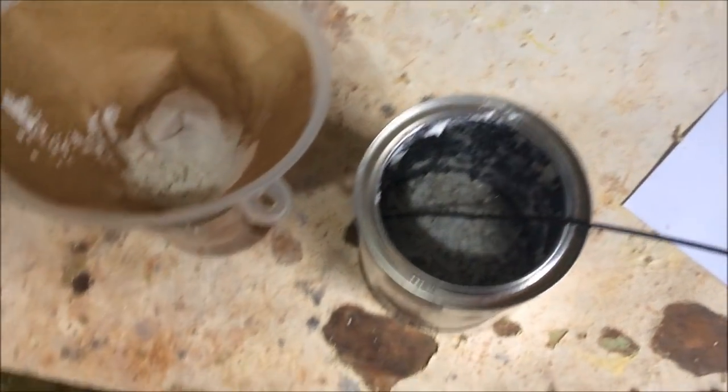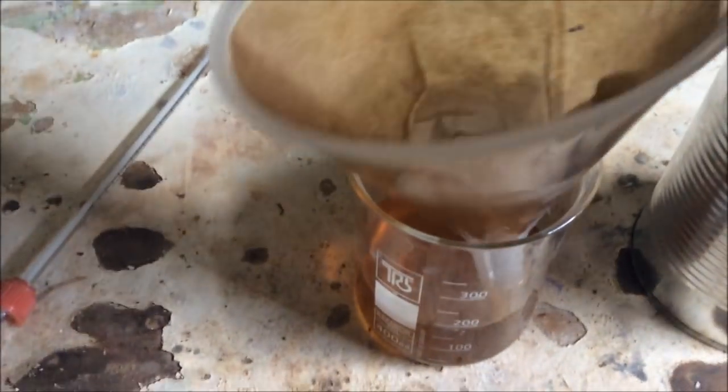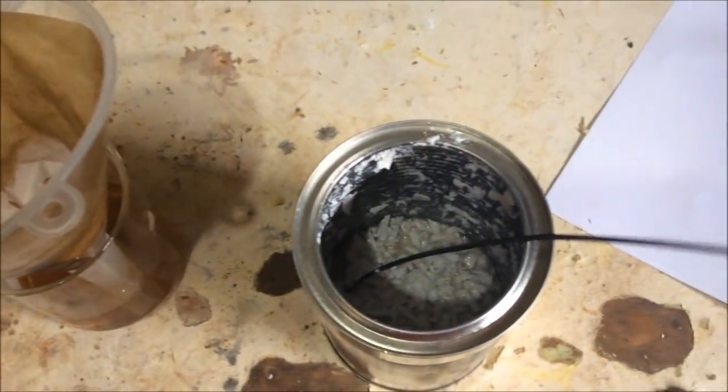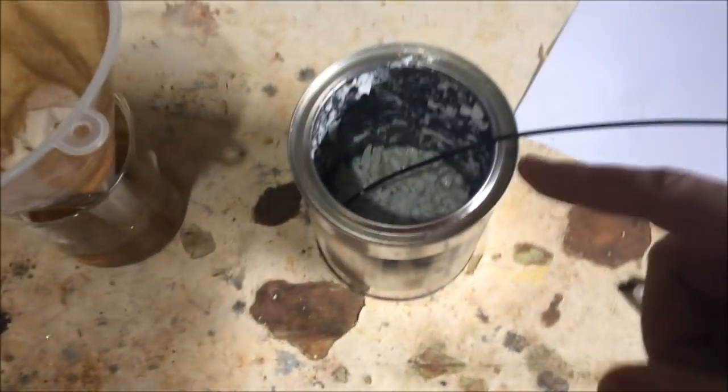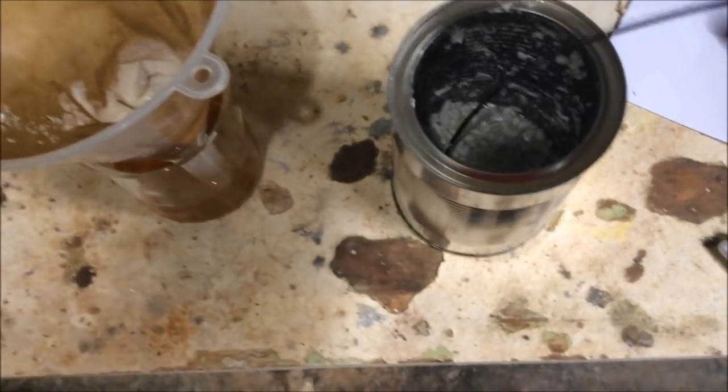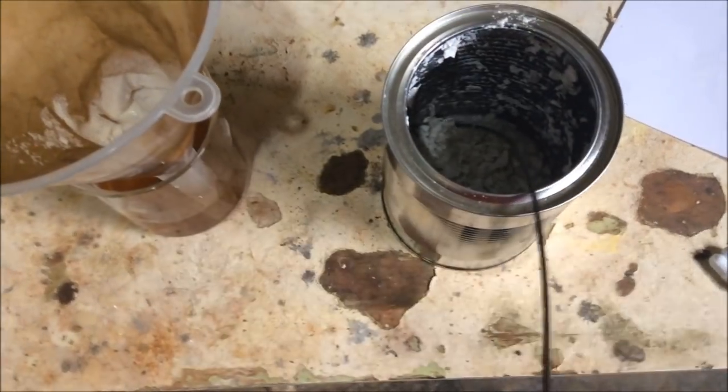Okay, I've filtered off the majority of the sodium terephthalate. That's all the ethylene glycol down there, and all the excess sodium hydroxide is seemingly dissolved in the ethylene glycol, so it's all been removed. It's a very thick mixture and takes a very long time to filter, and there's only a little bit of ethylene glycol left. Now that there's no remaining sodium hydroxide because it's all been washed out, I'm just going to heat this up to boil off all the ethylene glycol and leave us with the dry sodium terephthalate.